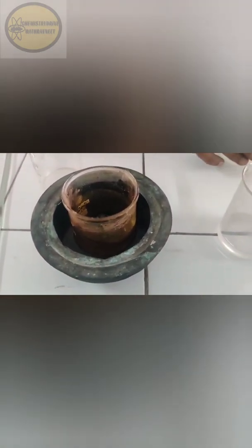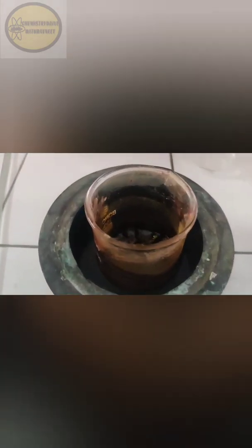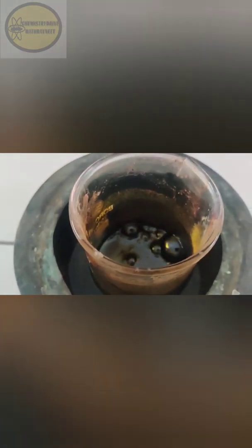Filter the orange-red product, give washing with cold water, perform recrystallization from boiling water, then filter and dry, and note the yield of the product.